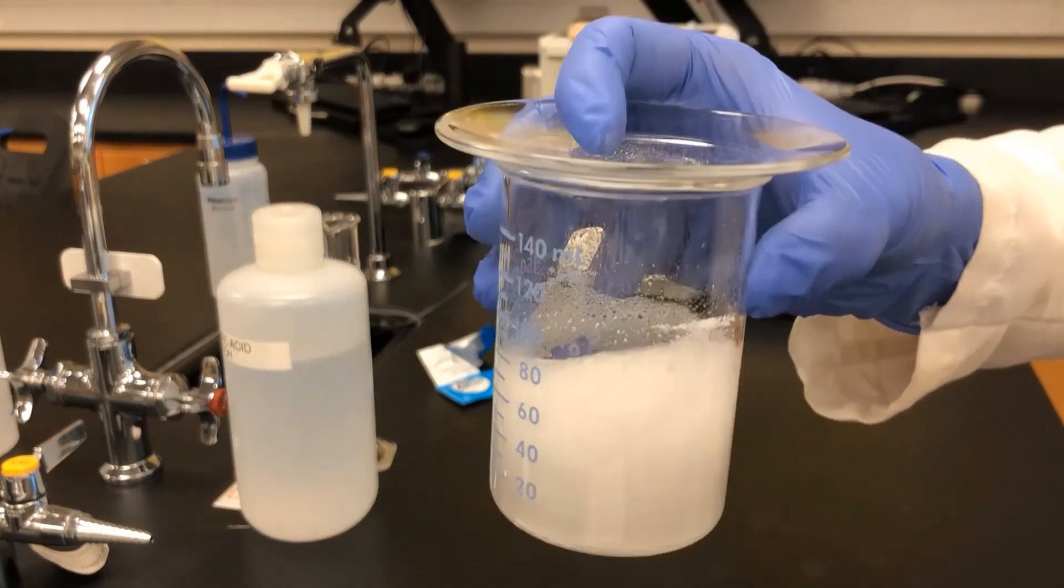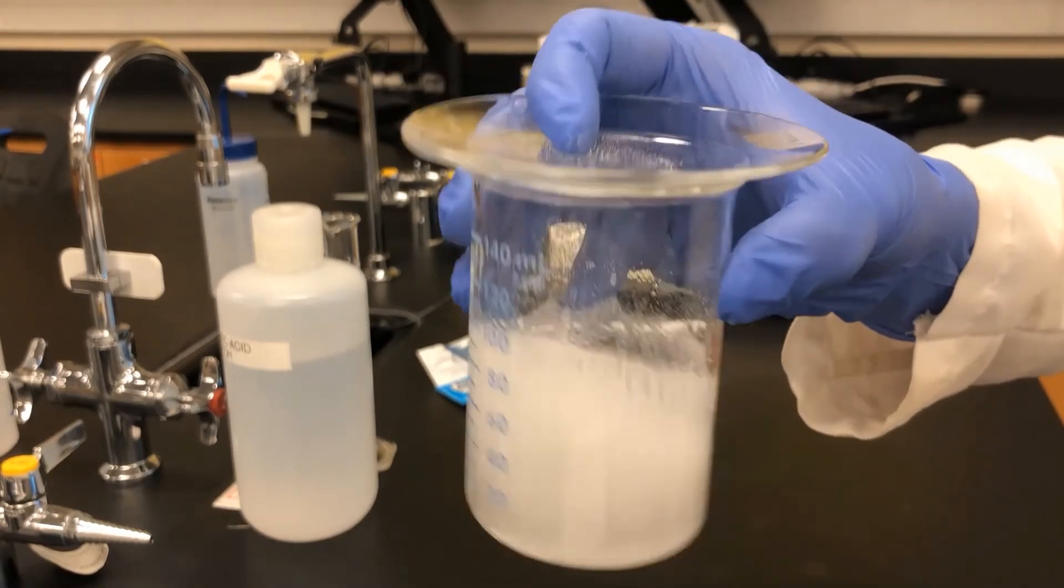To ensure that all the Alka-Seltzer tablet reacts with the acetic acid, the beaker is swirled.